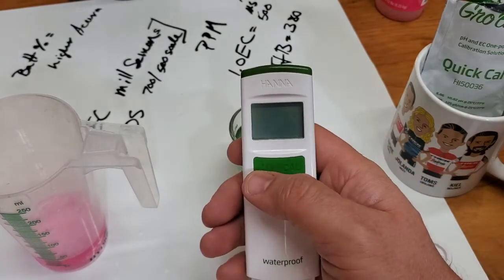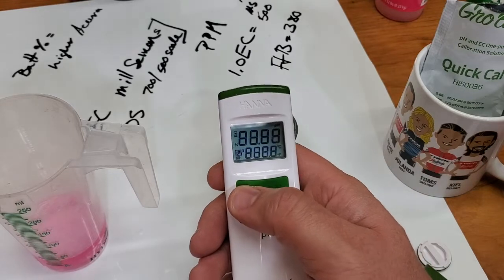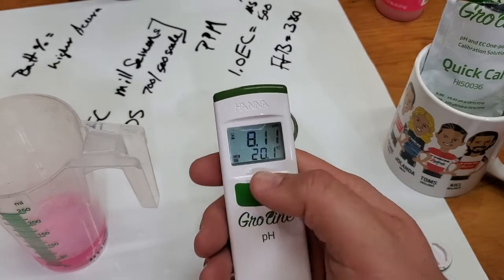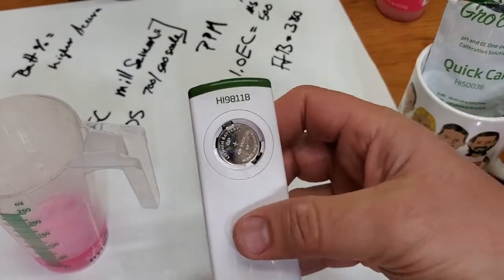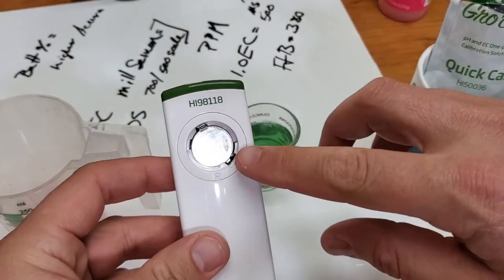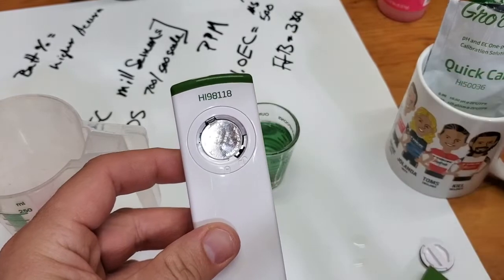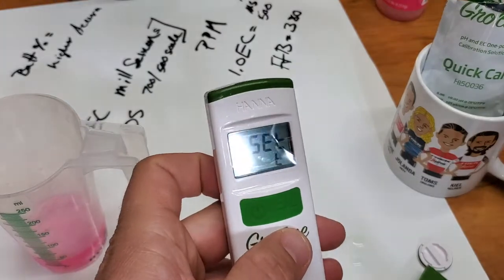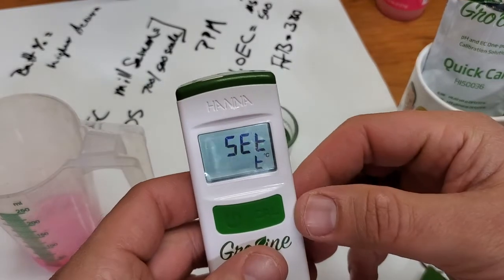When you first get this thing, you want to turn it on. It tells you the battery's at 100% - that's great. You want to flip it over and right down here, you see that little button in there. That's how you get to the menu of this thing. You hit the button, flip it back over.